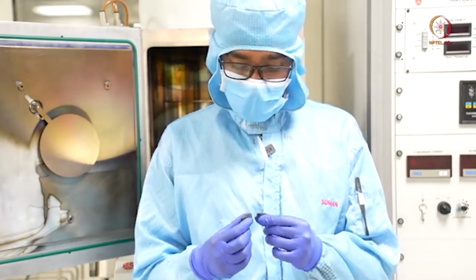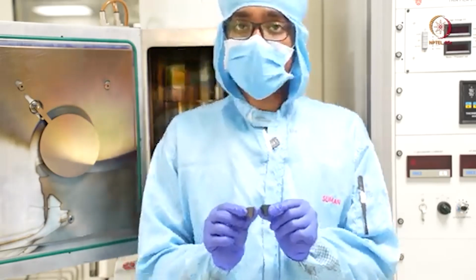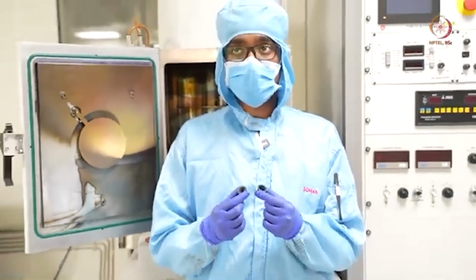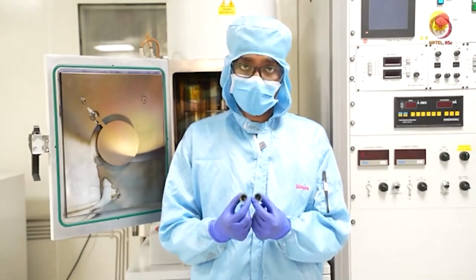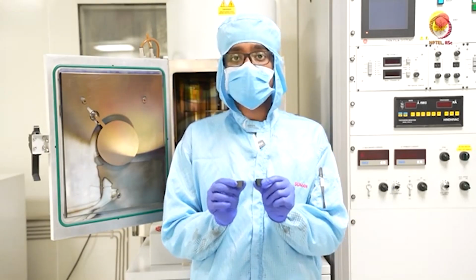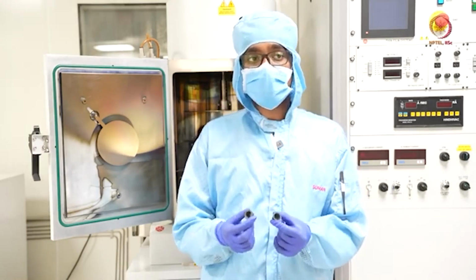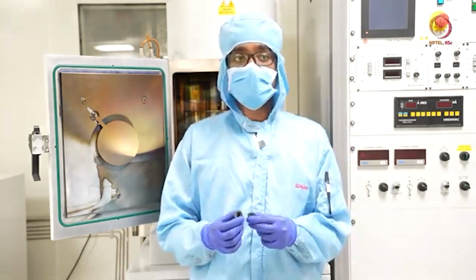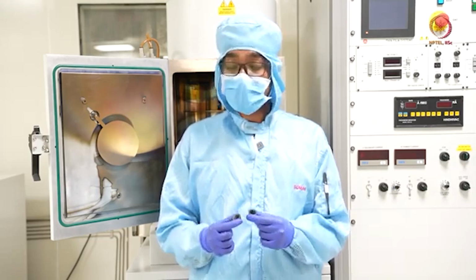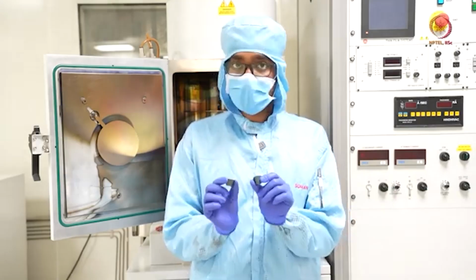Here if you see, this is of 15 cc. Crucibles are available for different volumes. How much material you want to place inside your chamber is governed by what type of crucible or how much volume you are getting. These are 15 cc, and like that you can have 15 cc, 25 cc, 40 cc. You can check any of the vendors' sheets and understand what types of crucibles are available and what the volumes are. So just a spare thing, I just showed it to you.